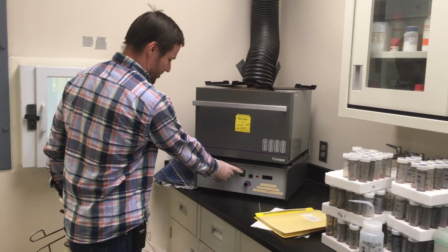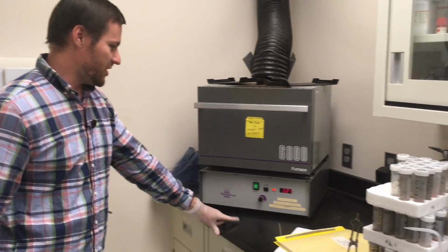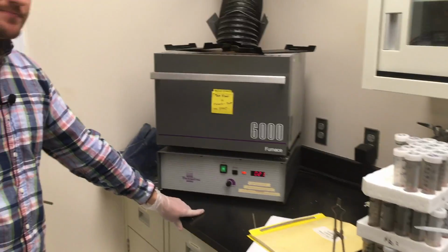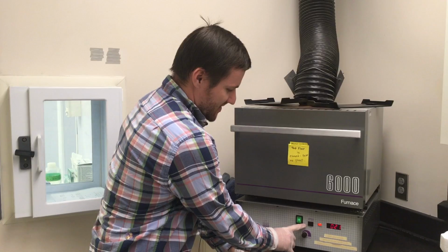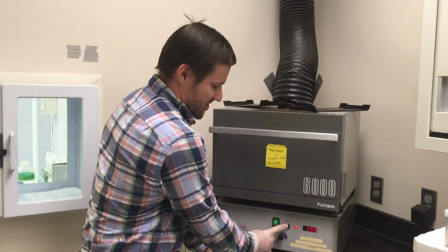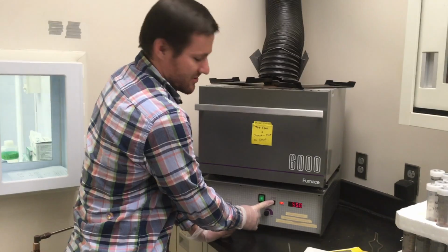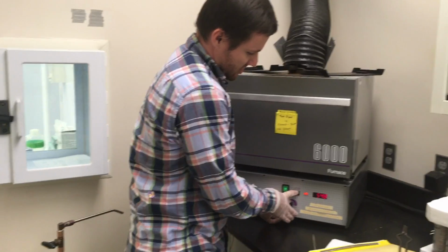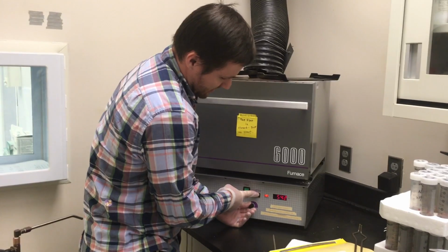And so you'll go ahead and turn on the asher, and when you first turn it on, it's going to tell you the temperature that's inside the asher right now. Right now it's 21 C, that is room temperature. But we don't want it at room temperature, we want it at 550 C. So this button that says push to set temp, you press and hold that, and that'll tell you the temperature at which it's going to try and heat. Somebody before me was running maybe similar samples or just doing a similar protocol. They want their samples at 550 as well. If this wasn't the case and the temperature was even lower, you would use this dial and ramp it up or down to the temperature that you want.